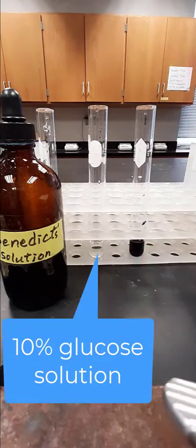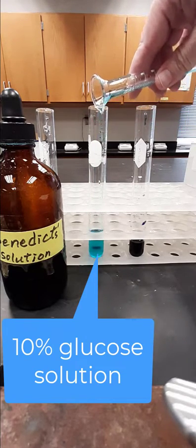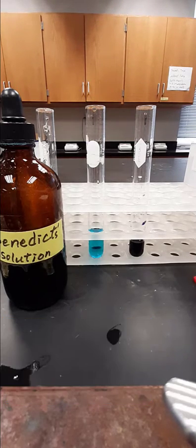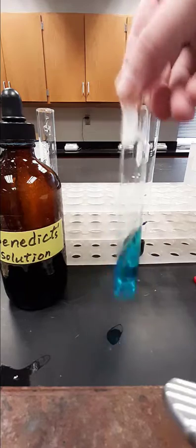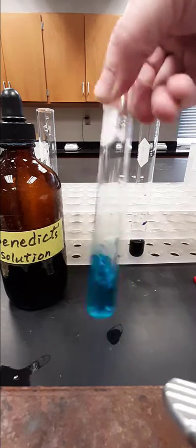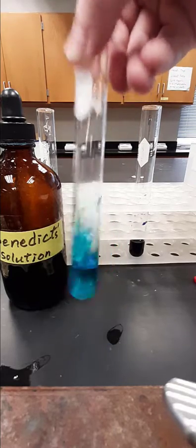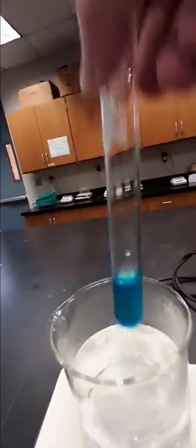Finally, I'm going to test for glucose by adding Benedict's solution to the test tube in the middle. Now this test works a bit differently from the two we've just seen. Merely combining Benedict's solution with glucose results in no visual change. However, heating the mixture for about five minutes in boiling water should cause a change to occur.